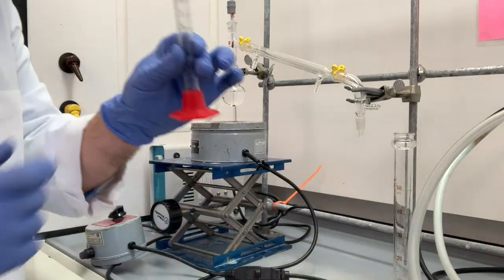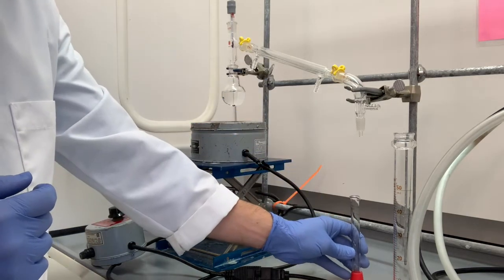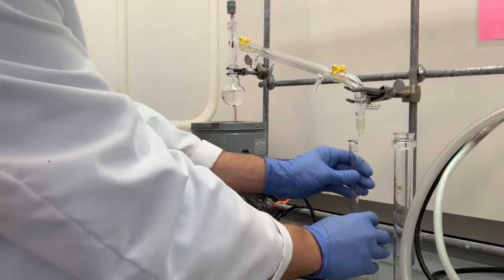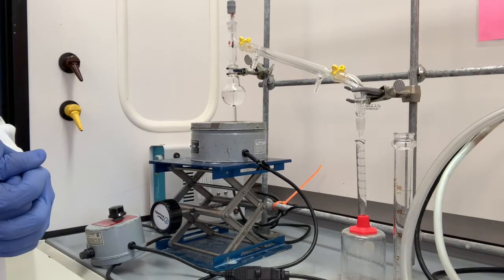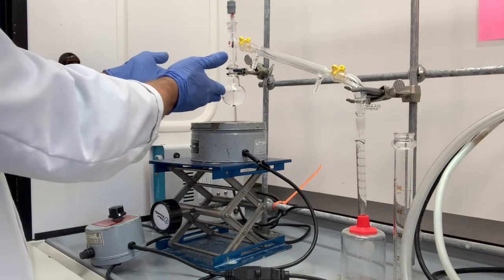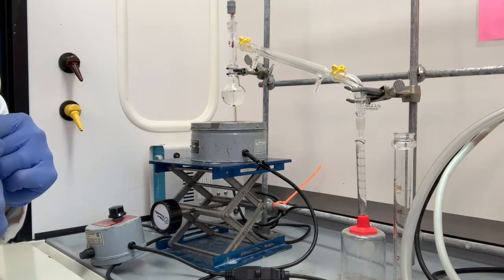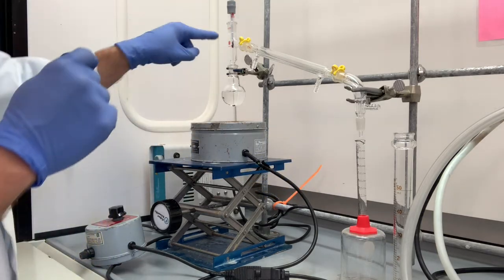Now you're going to begin taking measurements with a 10 milliliter graduated cylinder. Now you are living dangerously if you just set it down there. So you can take a beaker, put it upside down, and then set up the graduated cylinder in this way so that our drips come down. Just to make it completely clear what we're doing here, as we start boiling this sample, vapor is going to come up here, come over, condense, and then drip down into our graduated cylinder. And we're going to be taking notes at each 2 milliliter increment. What is the temperature reading right here?